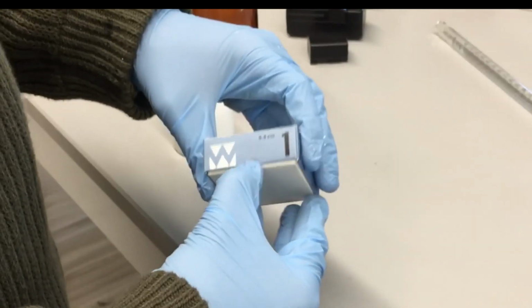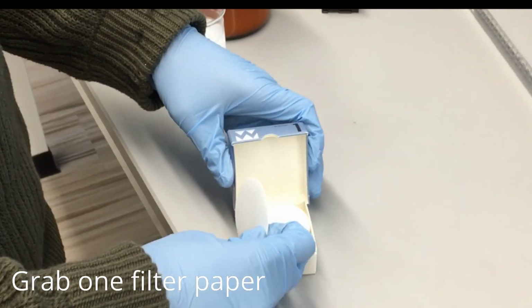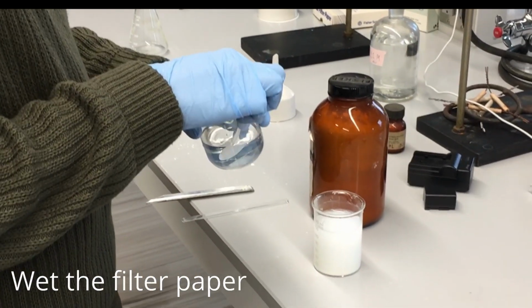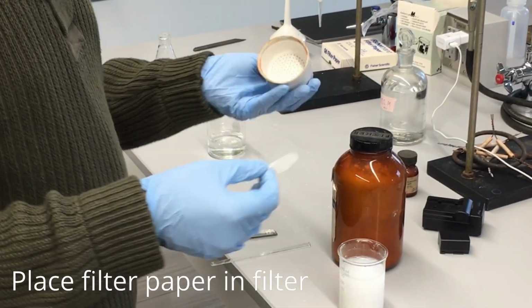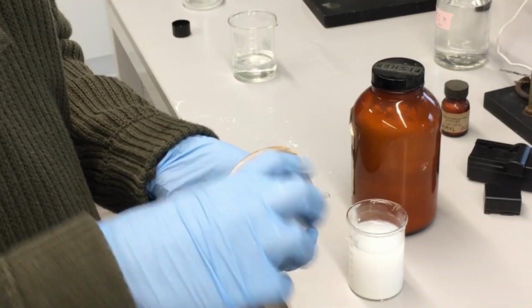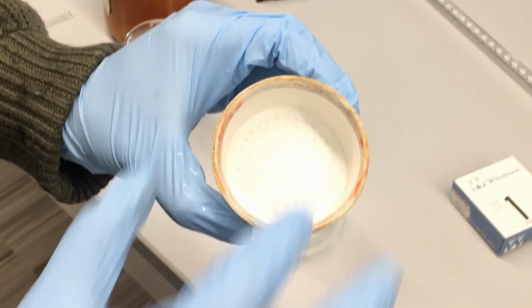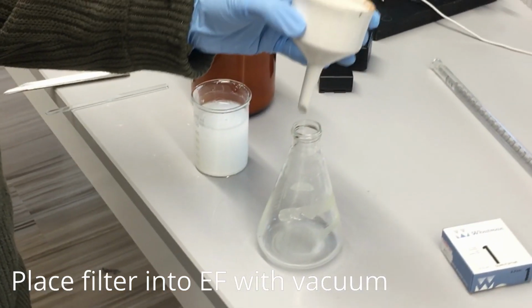So once we know that we've reached that saturation point, we could see that solids start to form at the bottom. We're going to go ahead and filter out the solid portion, so we only have the aqueous calcium and hydroxide ions. We're going to use a filter paper to do that, and a filter. So first we want to wet that filter paper and place it into our filter funnel, as you see here. That filter funnel allows us to filter out any solid particles from our aqueous solution. You can see here, it's got a bunch of holes to help filter the aqueous solution through.